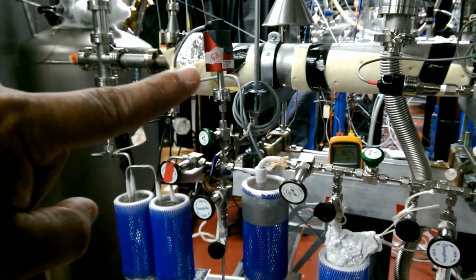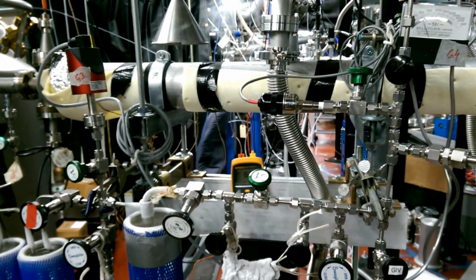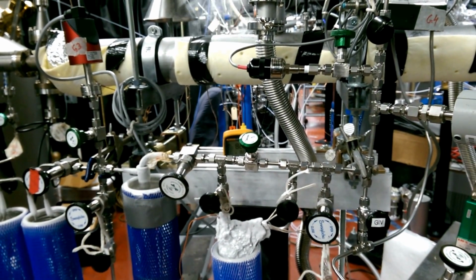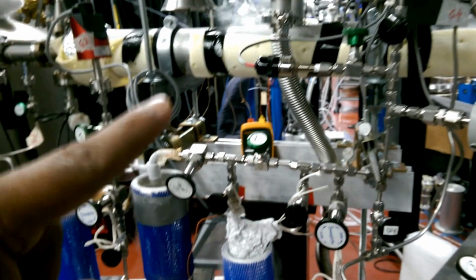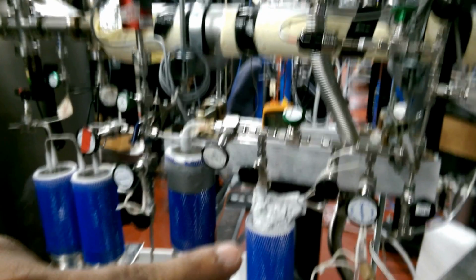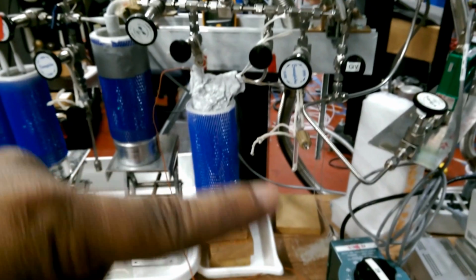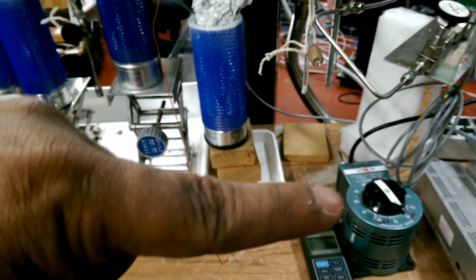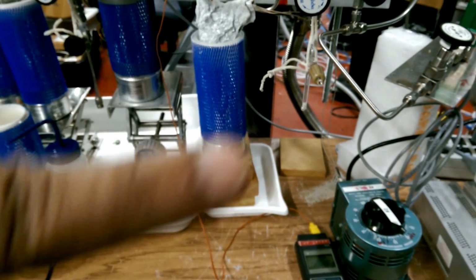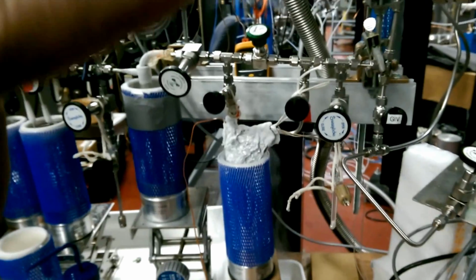But when we produce methane, it will not be trapped in this liquid nitrogen trap. We need another agent called molecular sieve, which is there in this trap, and this is temperature controlled. So we can change the variac setting and change the temperature of this. Right now, methane and CO both are getting frozen here in this trap.